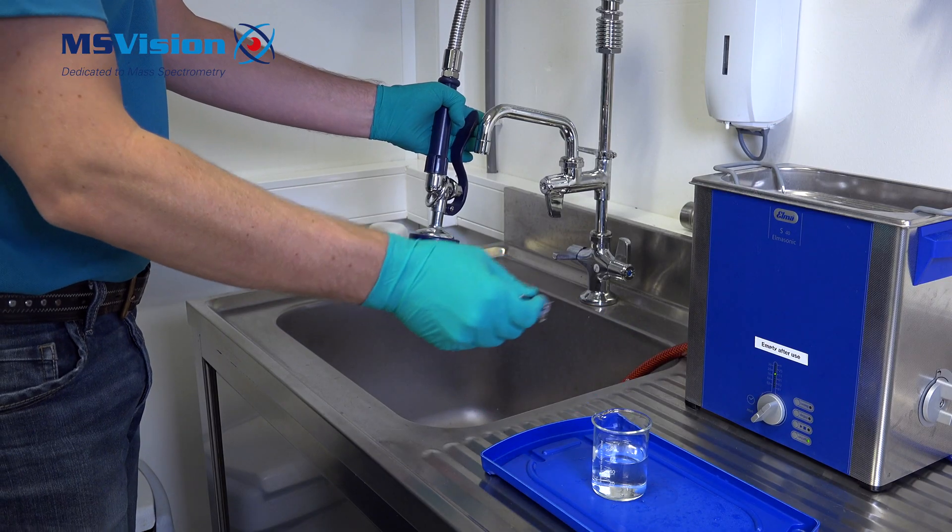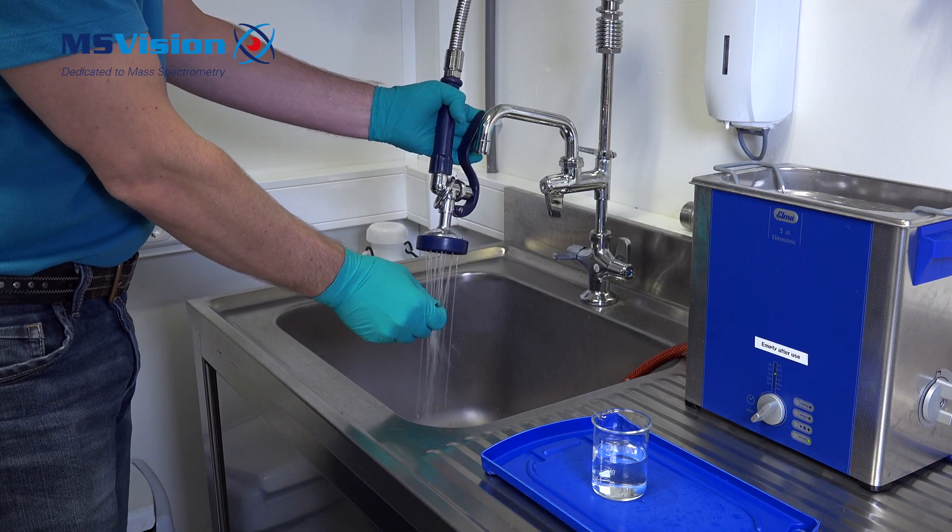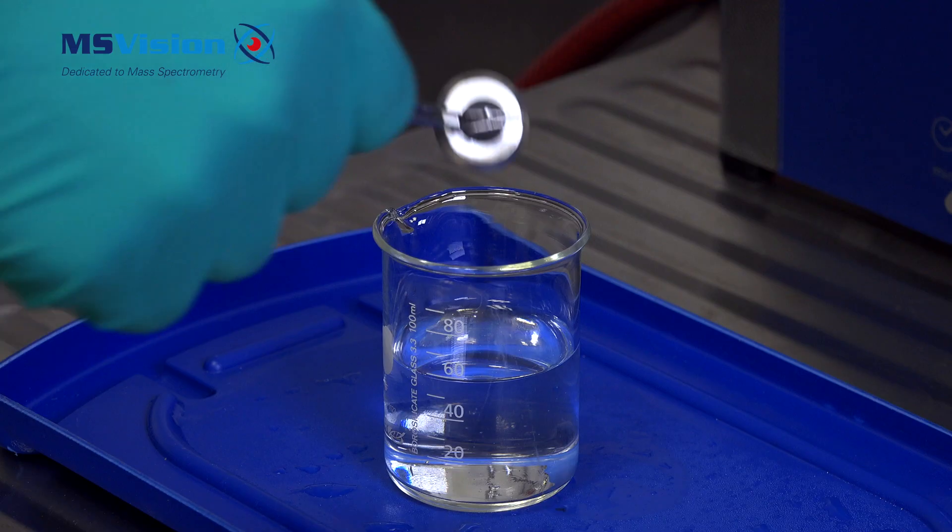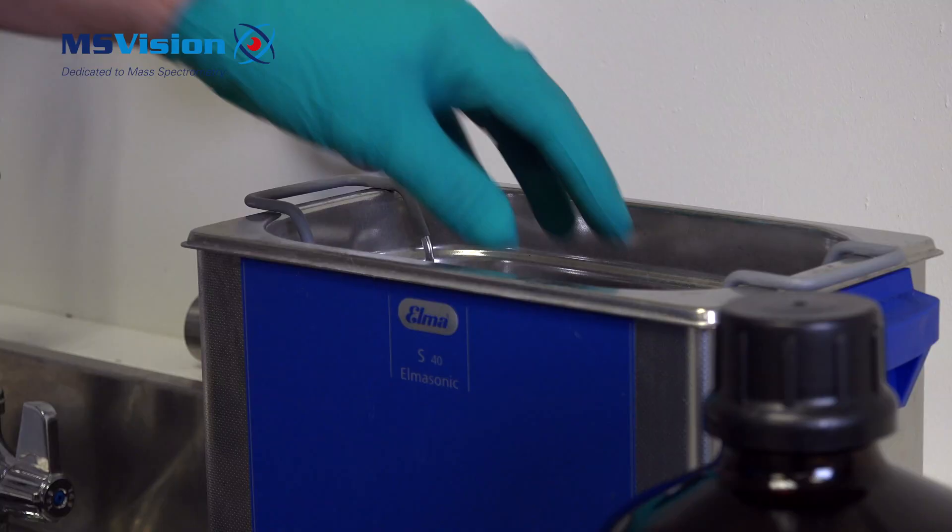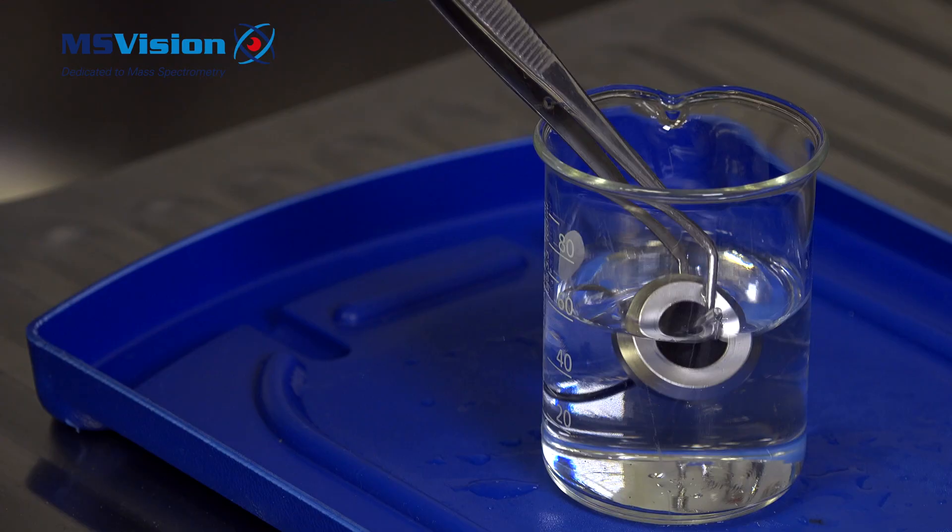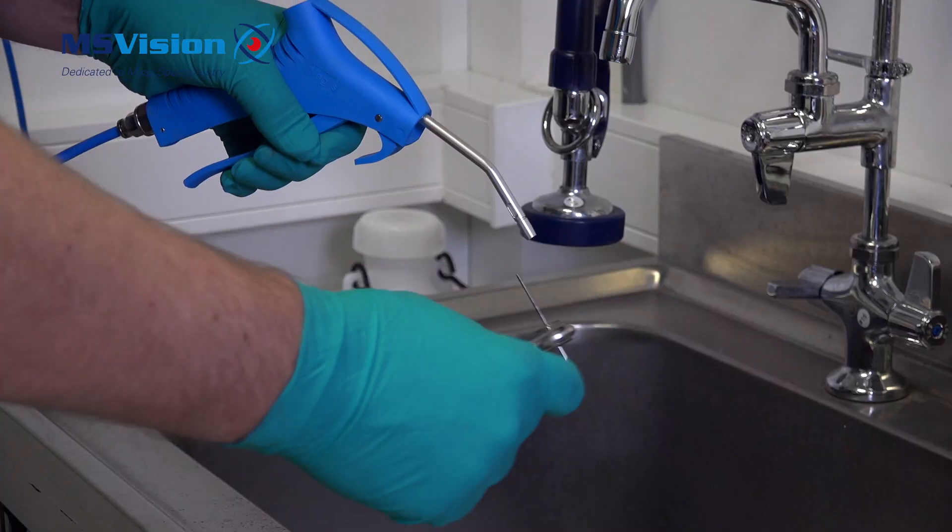Carefully remove and rinse thoroughly with water. Then we need to sonicate for a further 10 minutes using methanol. Remove from the bath. Carefully remove from the beaker and blow dry with nitrogen.